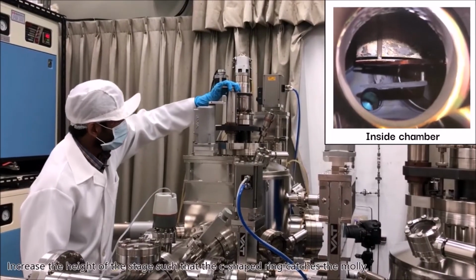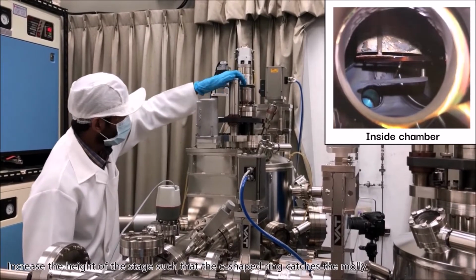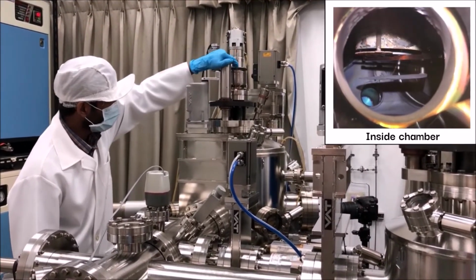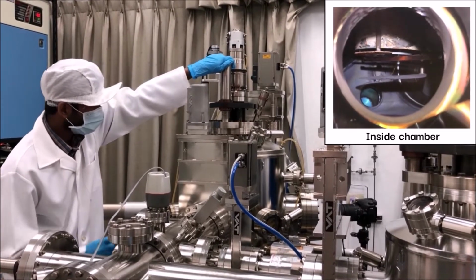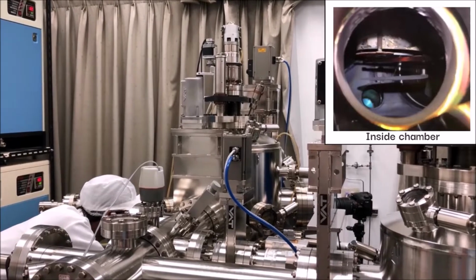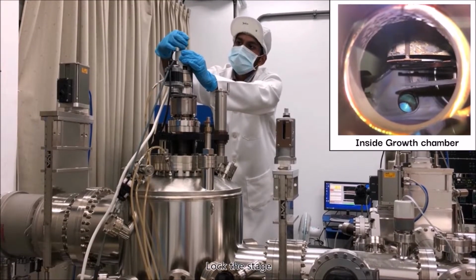Increase the height of the stage such that the C-shaped ring catches the moly. Lock the stage.